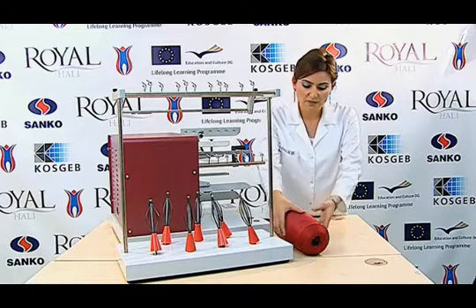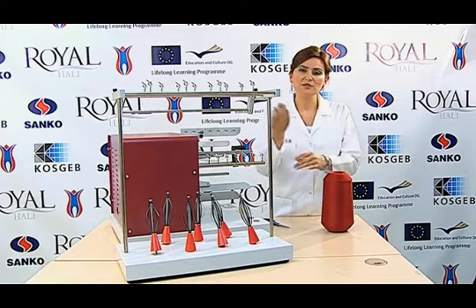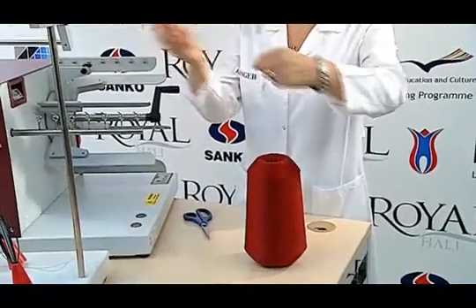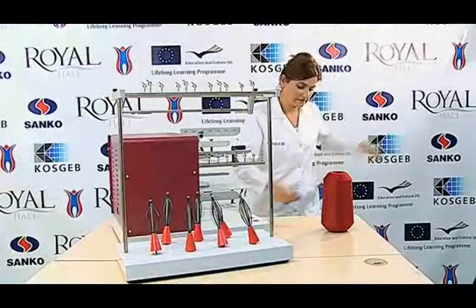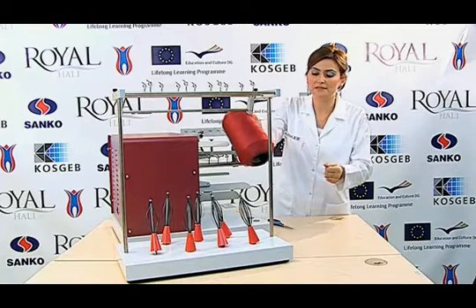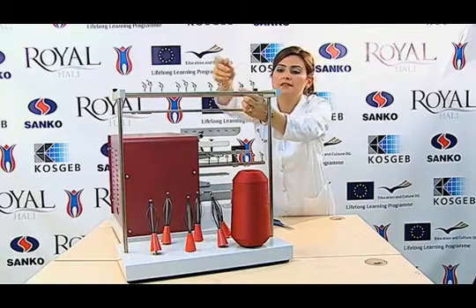Our sample has already been conditioned at stable atmospheric conditions for 24 hours. One to two meters of the conditioned test sample are discarded. This test can be applied to single-ply, multi-ply, and cable yarns. The bobbin is installed into the bobbin placement apparatus.